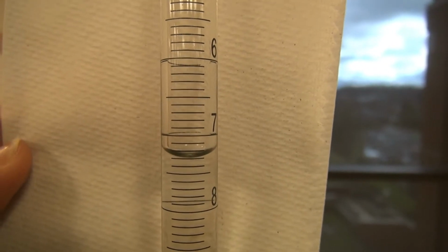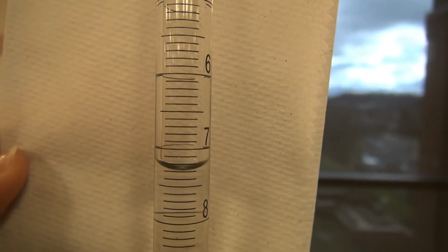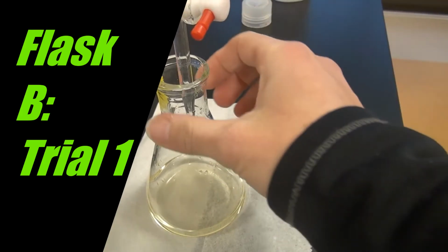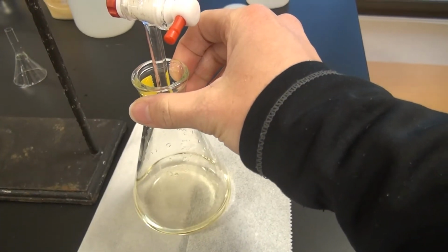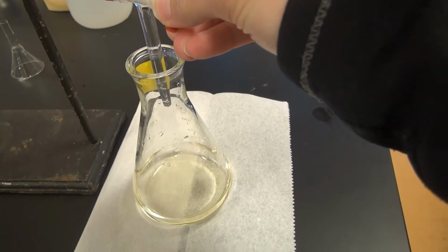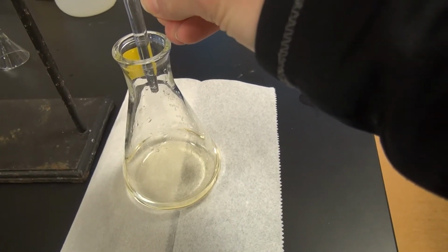Okay. All right. So now we're going to get our B flask set up and ready to go. Okay, we're starting at 0.00. This is our B flask, our first trial for the white wine, and we were just a little over 7 mils on the scout. So I'm going to do a pretty slow drip here throughout.